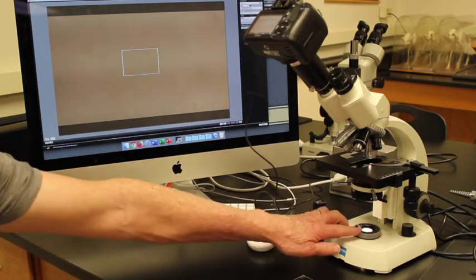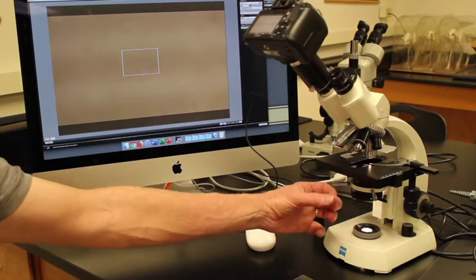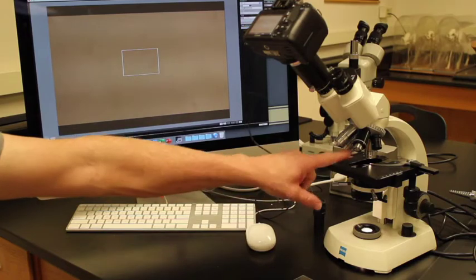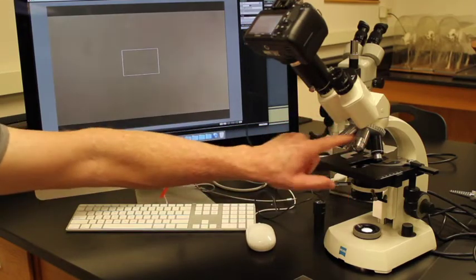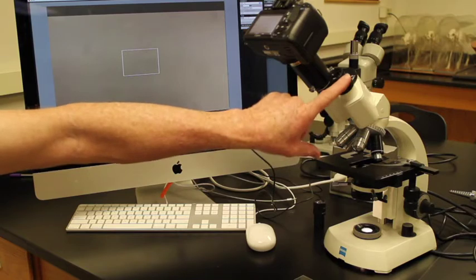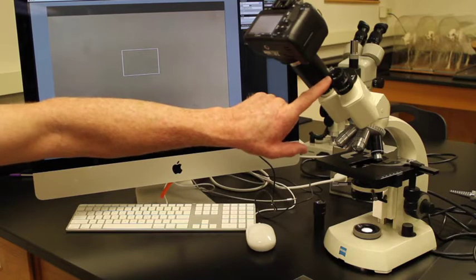Brightfield microscopes begin at the bottom with a light source. The light source shines light up through the substage. There's a condenser that basically focuses light. The light passes through an object, then goes directly through. It's transmitted up into one of these structures, which are called objectives. It then goes through this tube, bounces off a mirror, hits the ocular, and it's magnified again by this lens, which is a 10x ocular.